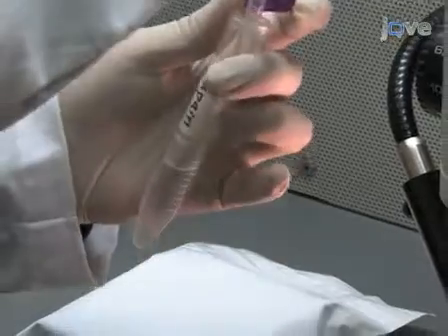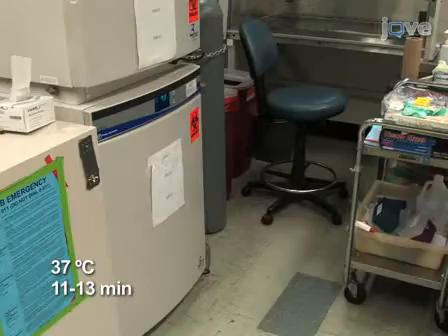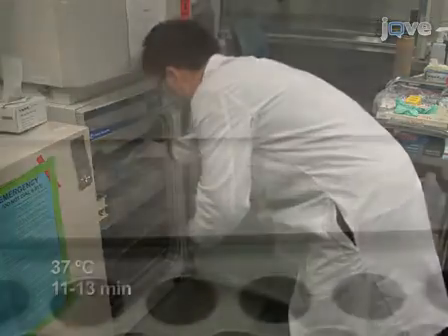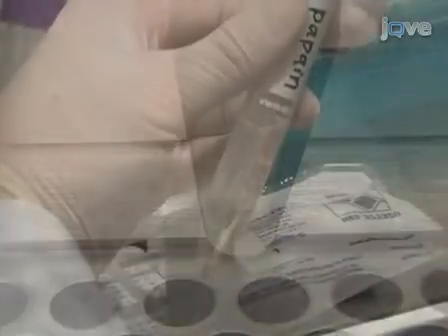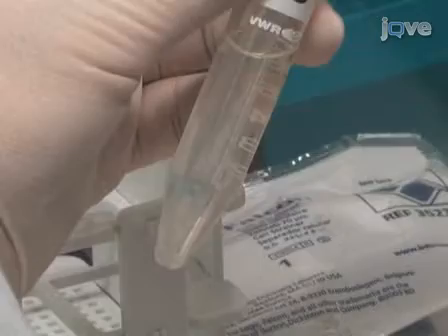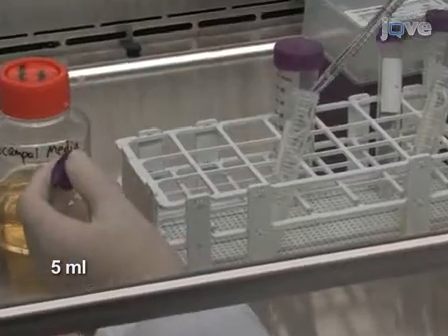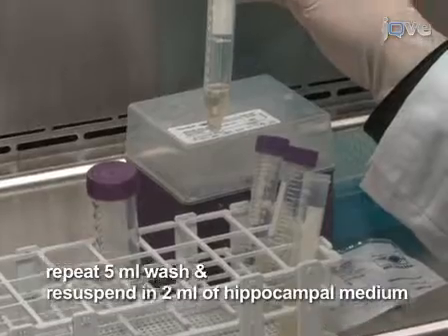Digest in papain solution at 37 degrees Celsius for 11 to 13 minutes. Remove the dissected tissue from the incubator. Then, once the pieces of tissue have settled, remove them from the papain digestion carefully and add 5 milliliters of hippocampal medium to wash the chopped pieces of hippocampi. Repeat this step, and then finally resuspend in hippocampal medium.